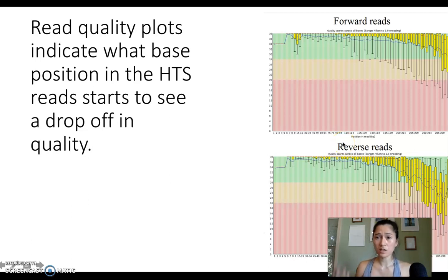Usually sequencing reads are about 250 or less base pairs long. What these quality plots do is summarize all of your sequencing data from all of your samples and then plot for you, at each base pair position, what overall the read quality looks like for that particular base pair. In general, like we see in our DNA Subway reads, the read quality generally drops off towards the end of the sequencing read. That's to be expected, but really what we can look at in these plots are where we find sequencing reads whose quality is unacceptable.